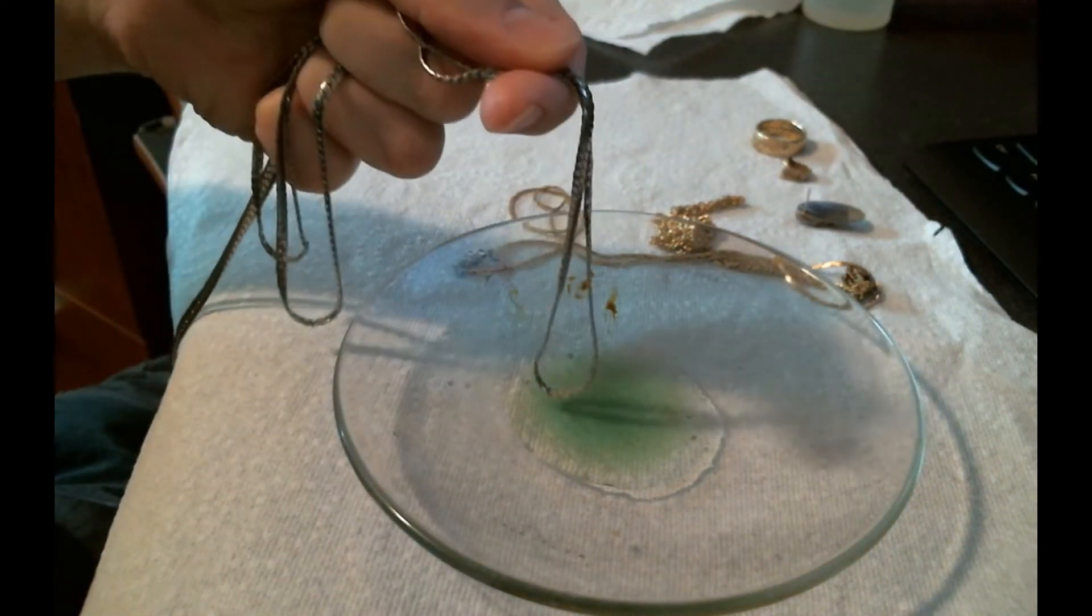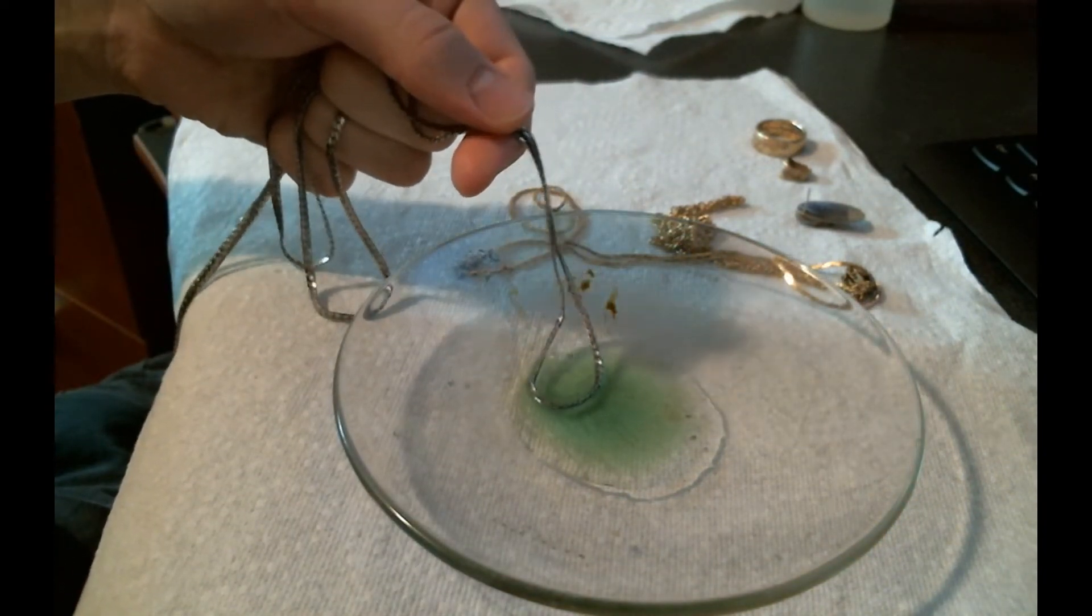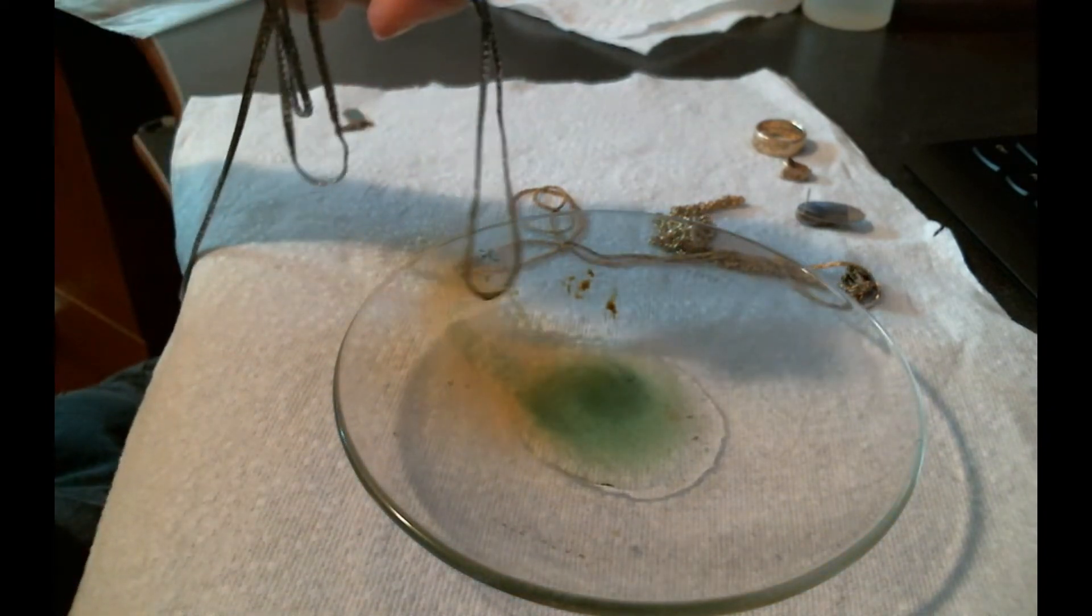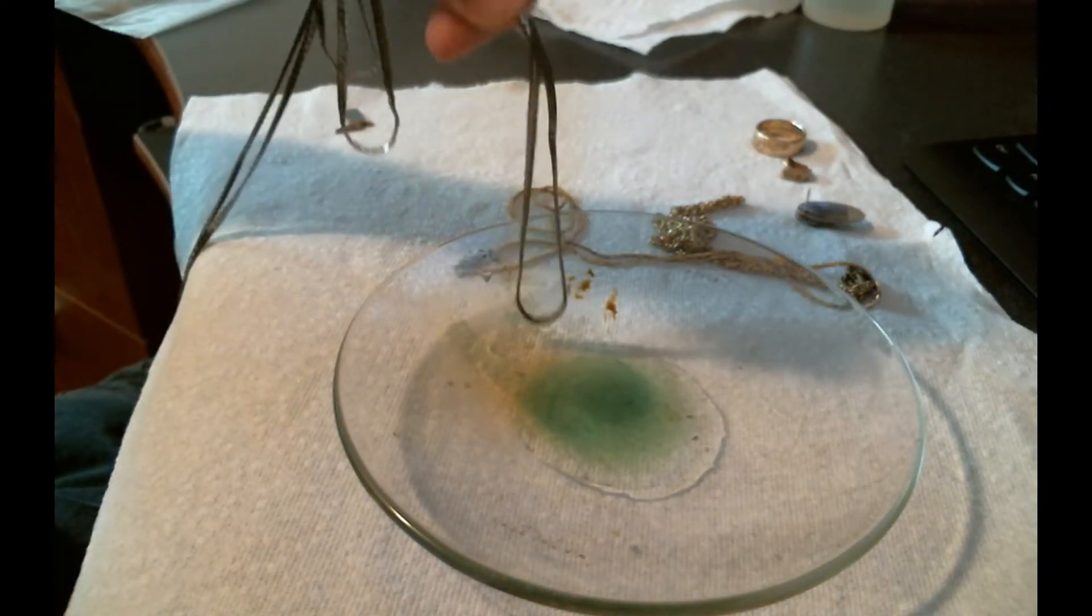Let's see. This was slow to react but it is reacting, and so you can definitely tell this is a base metal too.